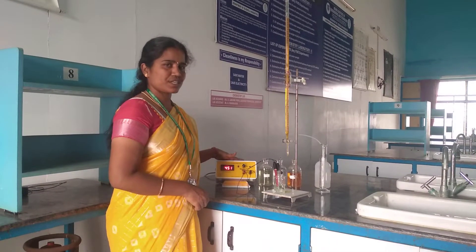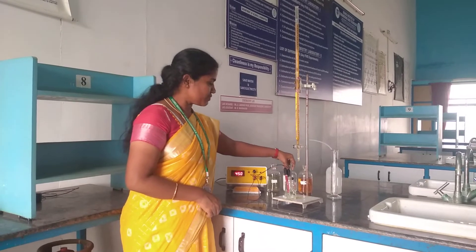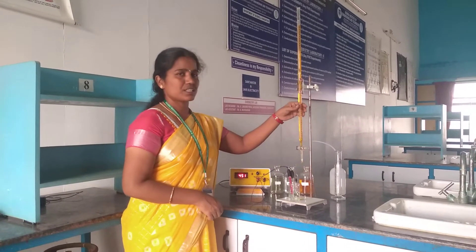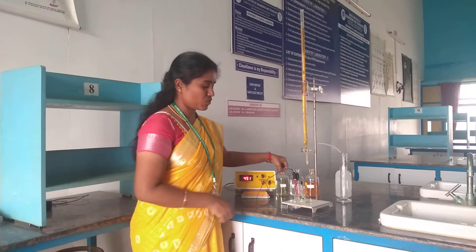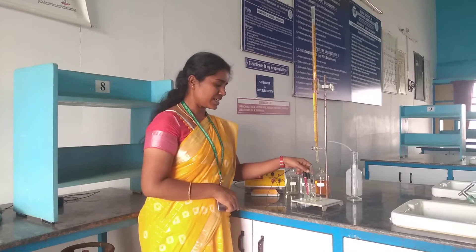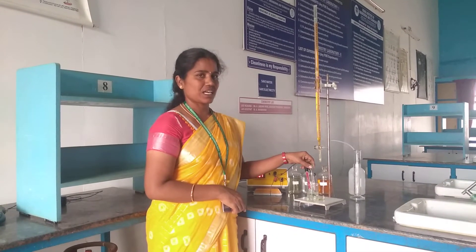This is the apparatus we are using to estimate the amount of ferrous ion. This is the potentiometer, then the ferrous ion solution which we are going to estimate. We are using acidic medium — sulfuric acid — and standard solution potassium dichromate. First we need to fill the burette with standard potassium dichromate, then take 20 ml of ferrous ammonium sulfate in the beaker. We are using two electrodes: first is the calomel electrode which is a reference electrode, and next is platinum which is an indicator electrode.